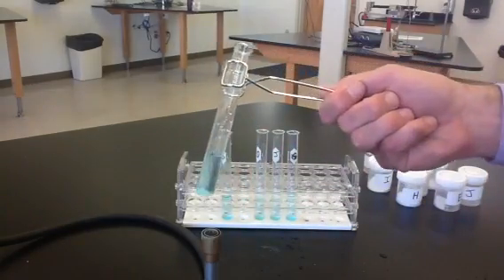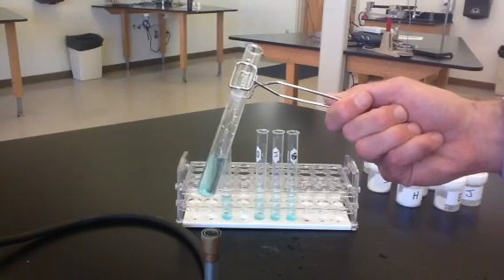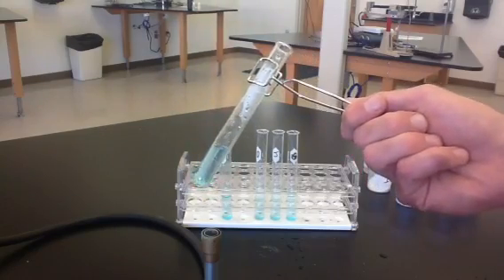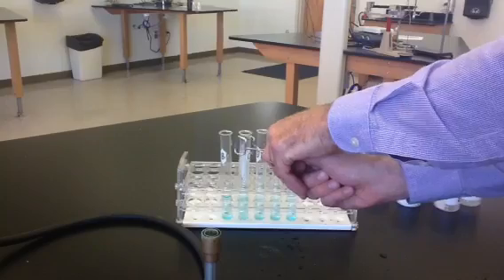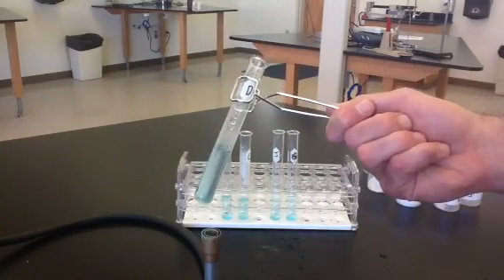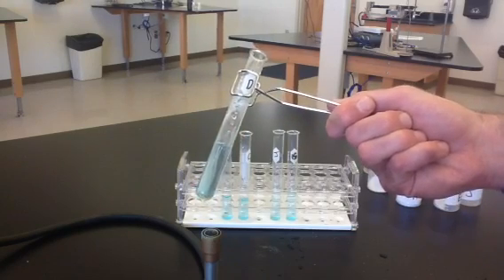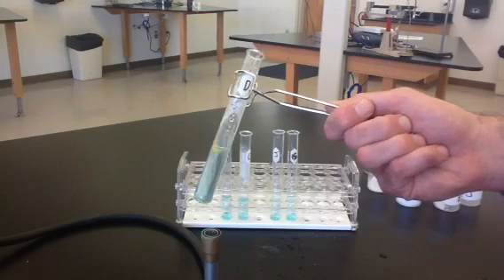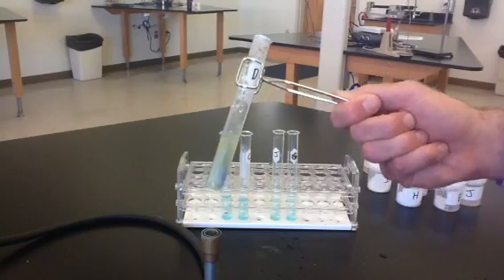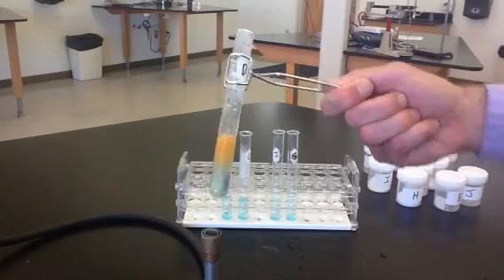Let's try solution C. We'll heat this. Some of it's still finishing dissolving, but we don't really see any color change occurring with C. We'll try D. We do have a reaction occurring here with D — the solution is changing from blue to orange with heat.